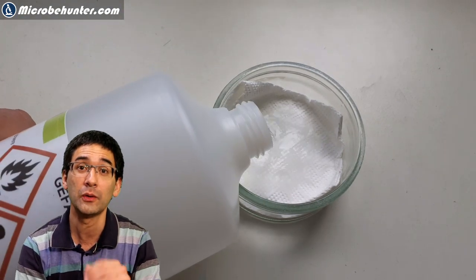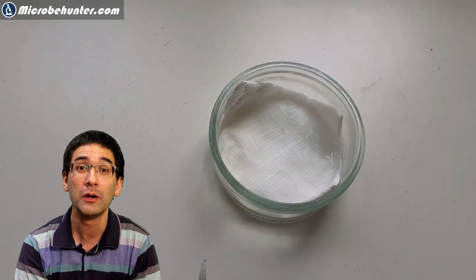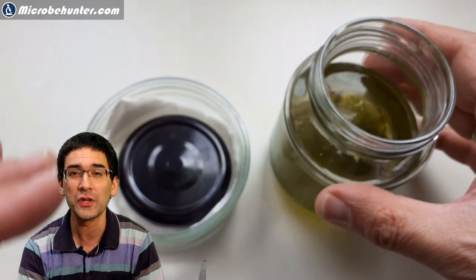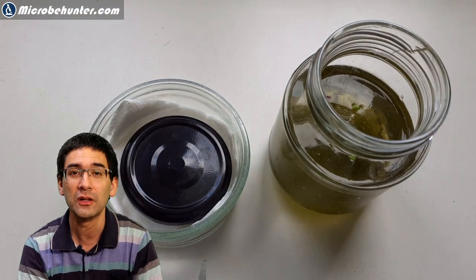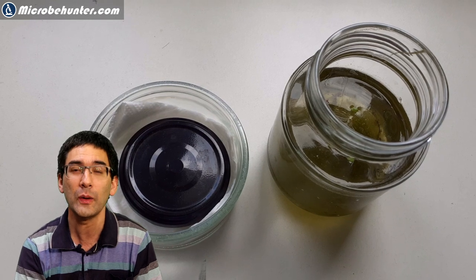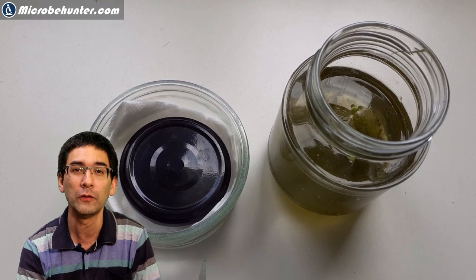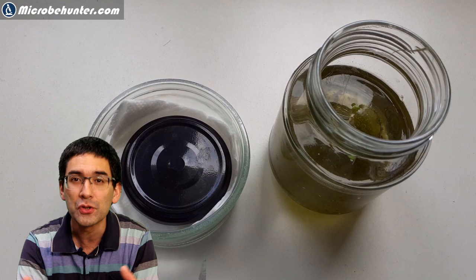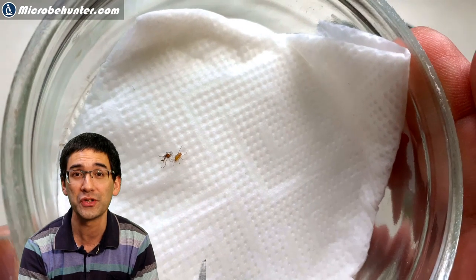They were sitting on the bottom of the lid, so I put some alcohol on tissue paper. I'd already opened it carefully before, so I knew there were three mosquitoes in there sitting on the lid. I quickly moved it over the alcohol for a couple of seconds, and the vapors killed those mosquitoes.